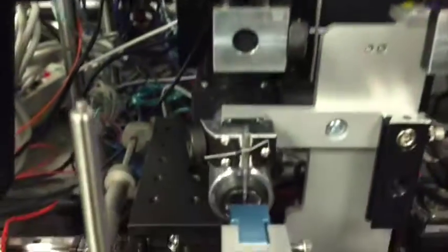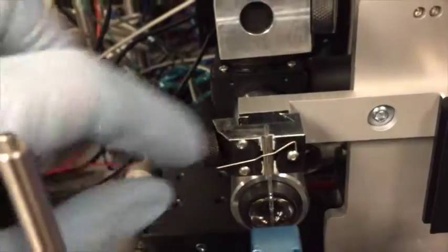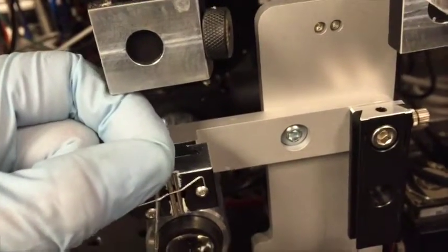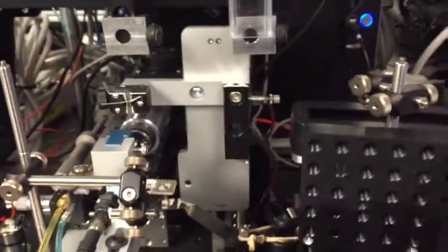All I need to do is pull it out of its mounting right here. So what I usually do is I scoot it up a little bit until there's a little end showing. Once there's an end showing, I can move it sideways out of here very carefully to keep it away from everything and put it into its box. And that's it. All done.